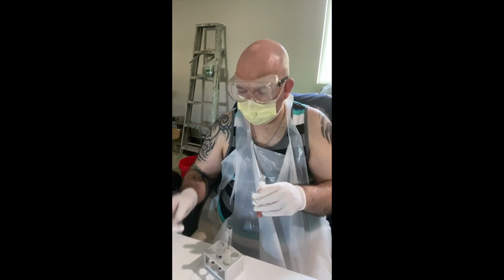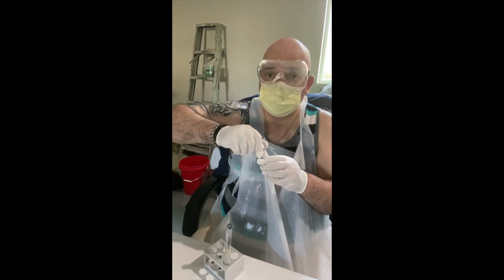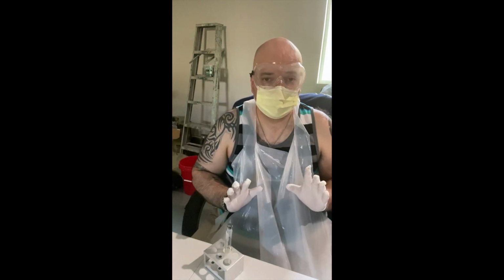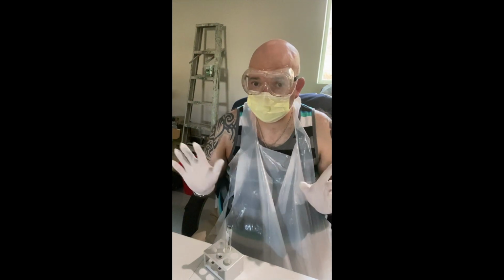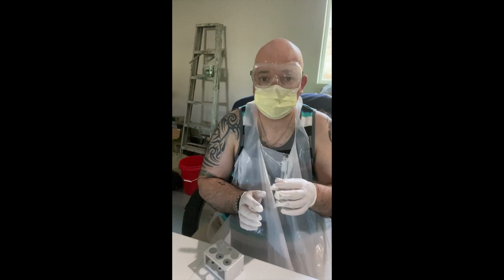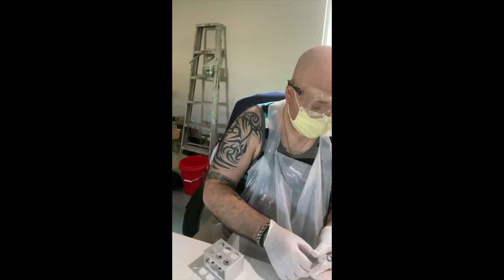Okay, lid on. I don't know if I mentioned at the inception of this video, but I did allow everything, the phenol red, all my cultures out of the fridge for a good 45 minutes to an hour just to come to room temperature. I'm going to flame my culture tube.